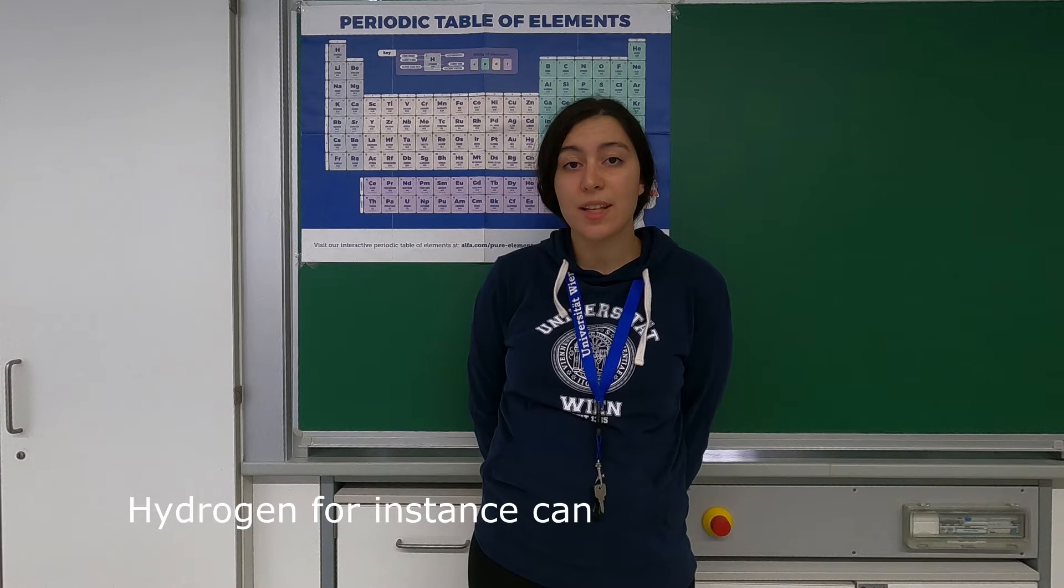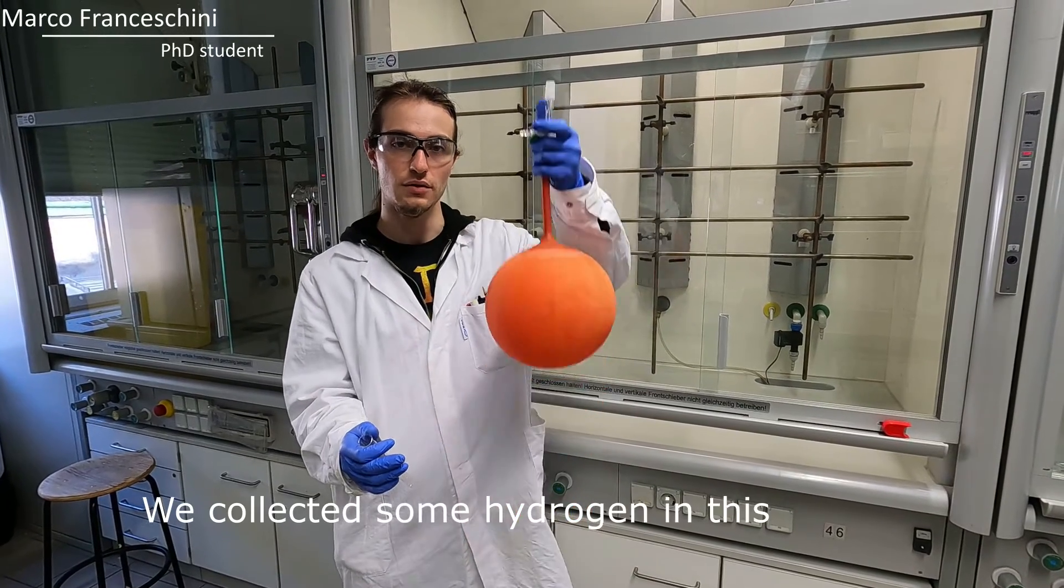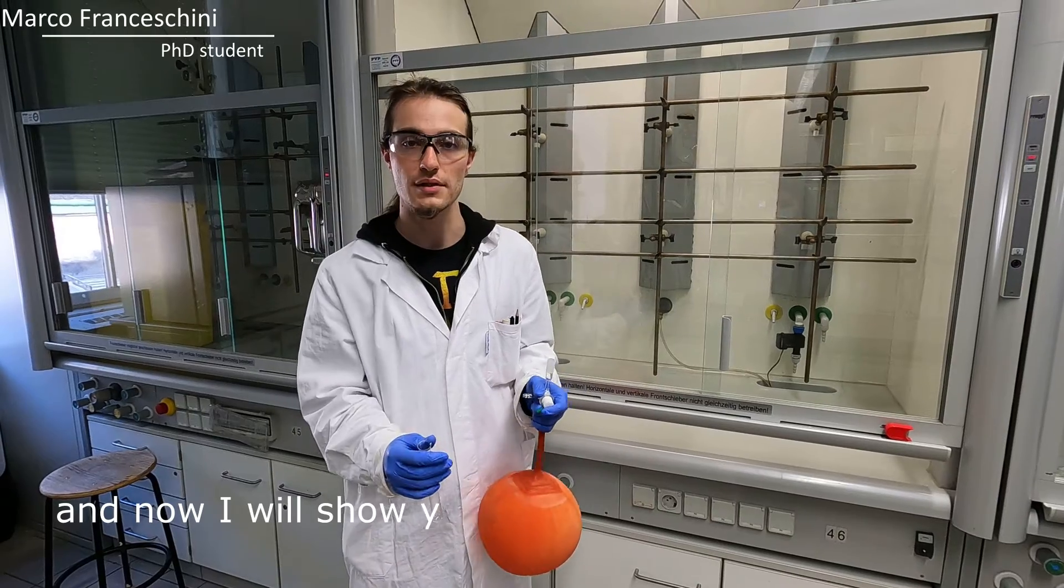Hydrogen, for instance, can be used as fuel for rockets. We collected some hydrogen in the balloon and now I will show you what happens when it burns.